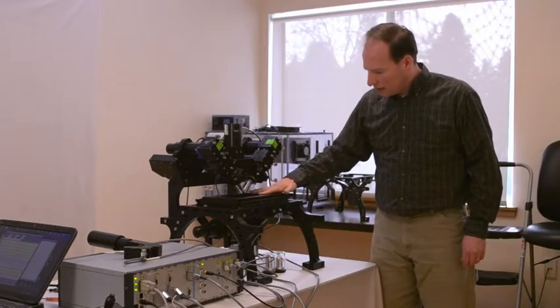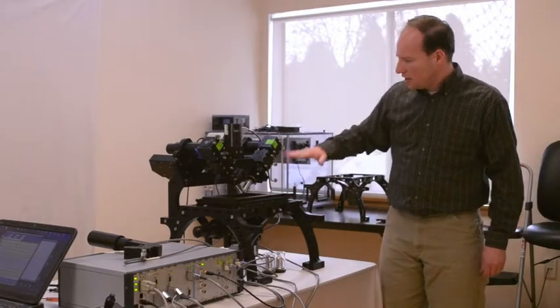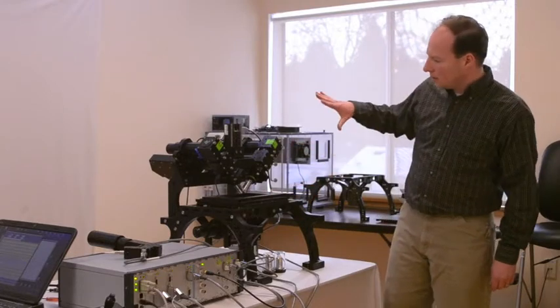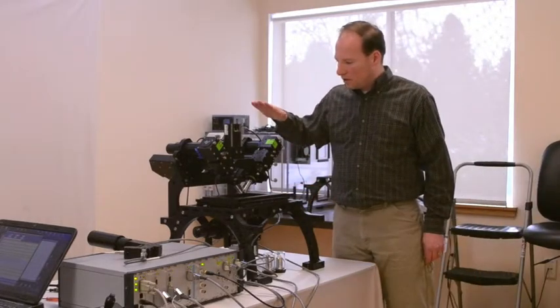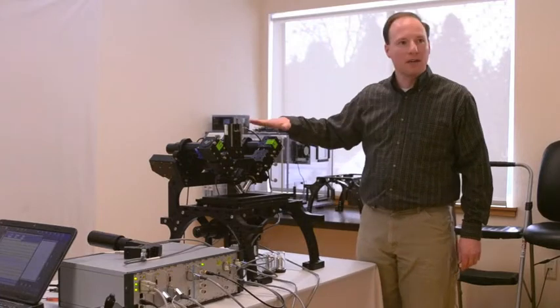So the sample is held here in the XY stage. We use the inverted microscope to find the sample, and then the light sheet microscopy is all happening up above.